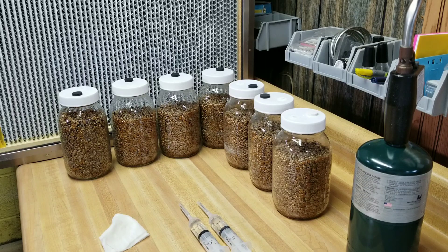I'm inverting the jar and smacking it lightly on my hand to knock those wet grain kernels stuck to the inside sides and bottom loose, then rolling some of the dryer kernels back down in their place. I kind of invert it and then roll it back, invert it, roll it back, as I'm smacking it on my hand. What I'm trying to do is just re-evenly distribute the moisture.